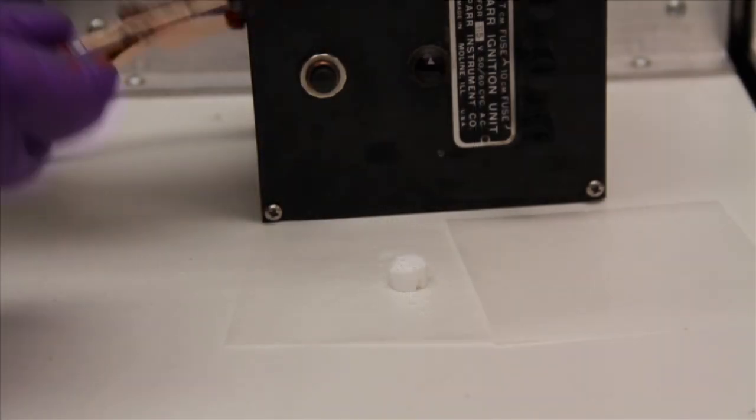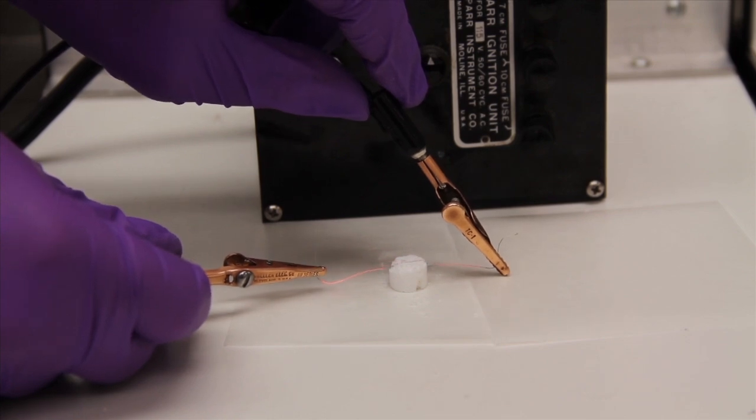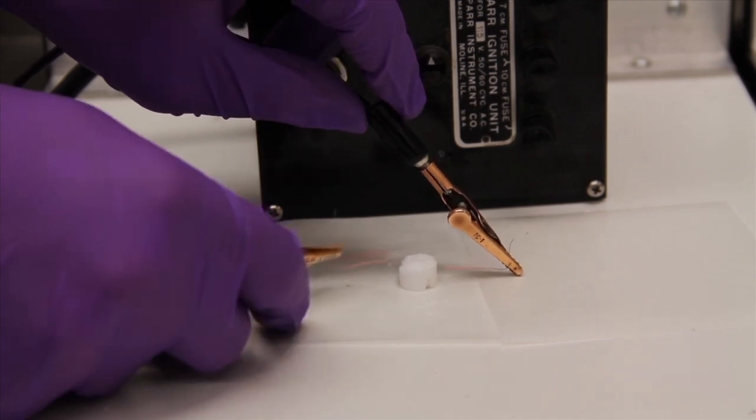A piece of iron wire of known mass is fused to the sample and the mass of the new aggregate is taken to obtain the mass of the sample by difference.